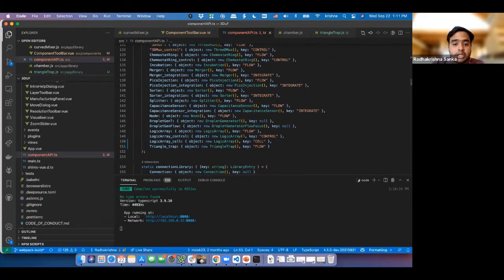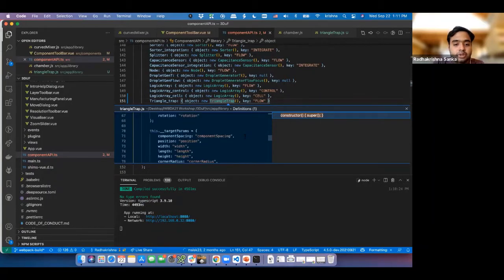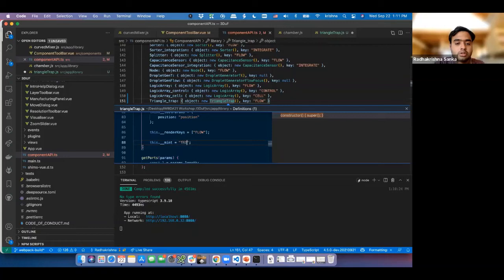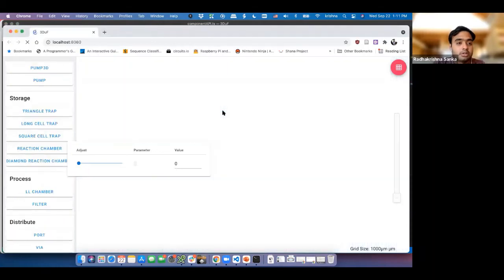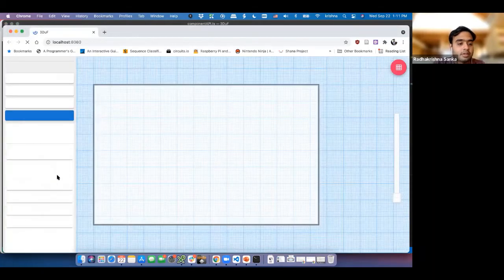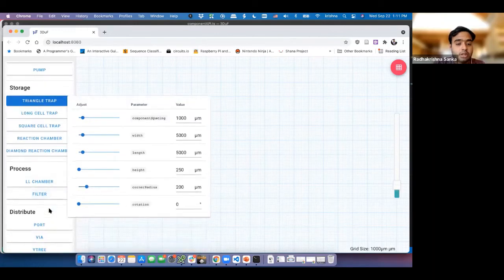What we need to do is go into the triangle trap code, and we'll be going down, and there'll be a parameter called mint. And we're going to modify this to triangle trap exactly the way we wrote it over there. So this way, now it actually knows which design it needs to pull from. Okay, reload. And there you go. It all works.